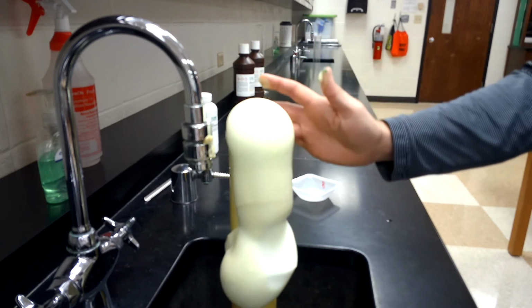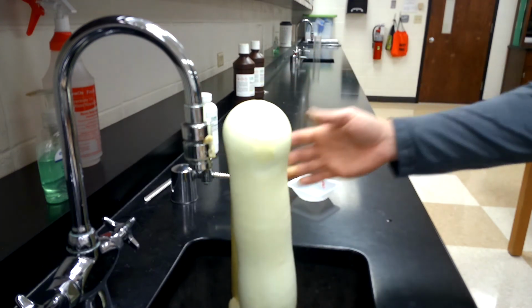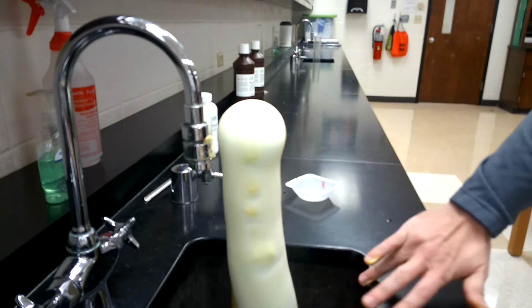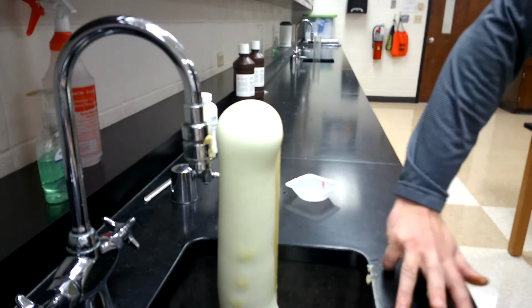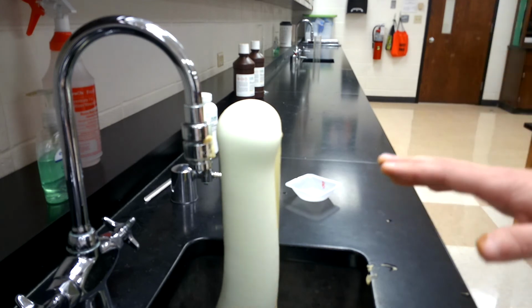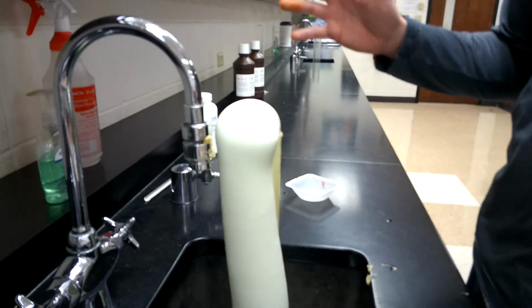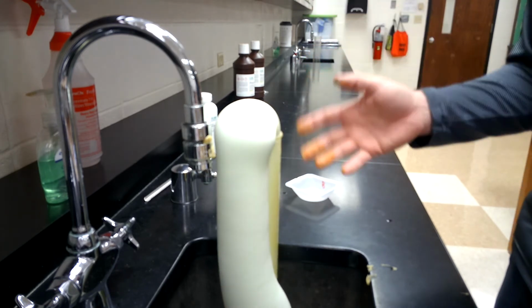And it just kind of keeps going for a while. In fact, if I let this sit here, it would just keep reacting like this until one of two things: until the hydrogen peroxide ran out, or the bubbles ran out of soap, basically. Those would be your options for when this will actually stop. But hopefully you get the sense that this isn't the cool, explosive, hit-the-ceiling reaction that you see all over the place on YouTube or anything like that.